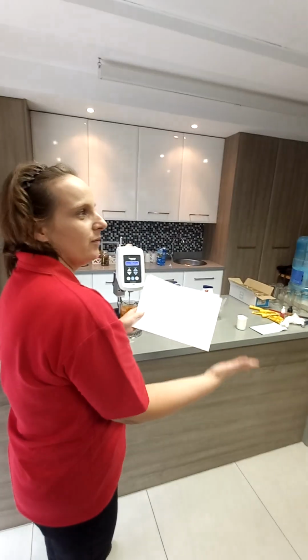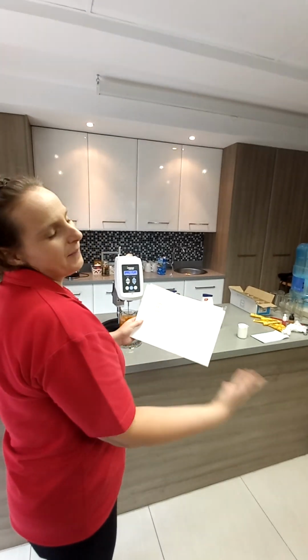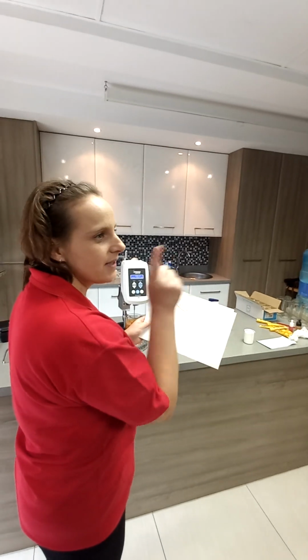But for you guys, it would actually be good to do the graph every time. And that's what we mainly call rheology of the sample. You've got a viscosity profile instead of a 1 point.